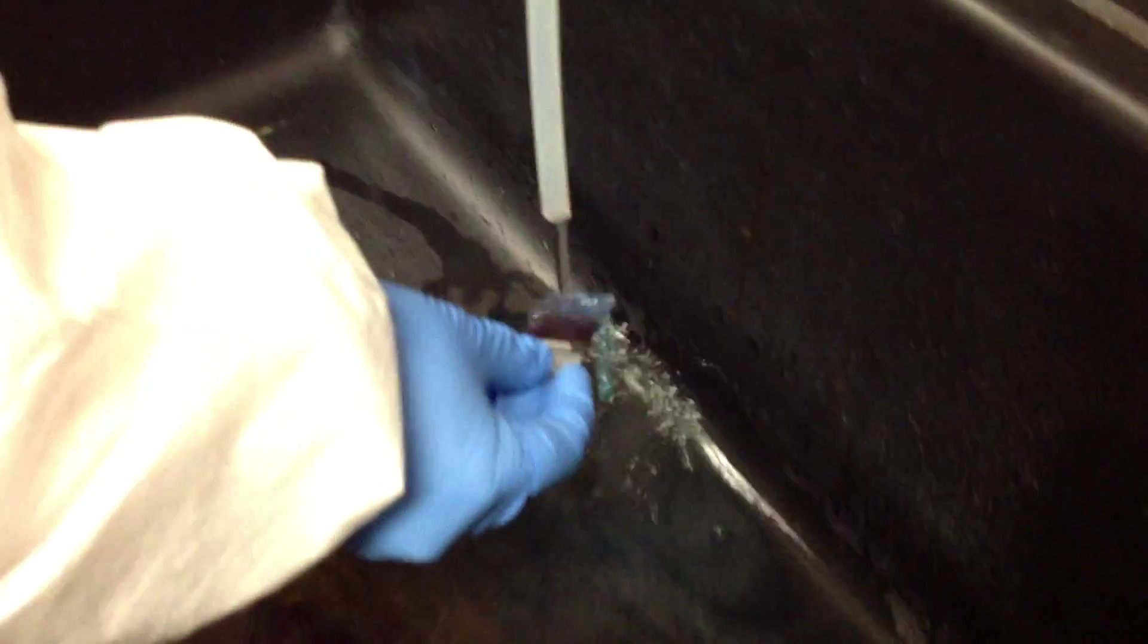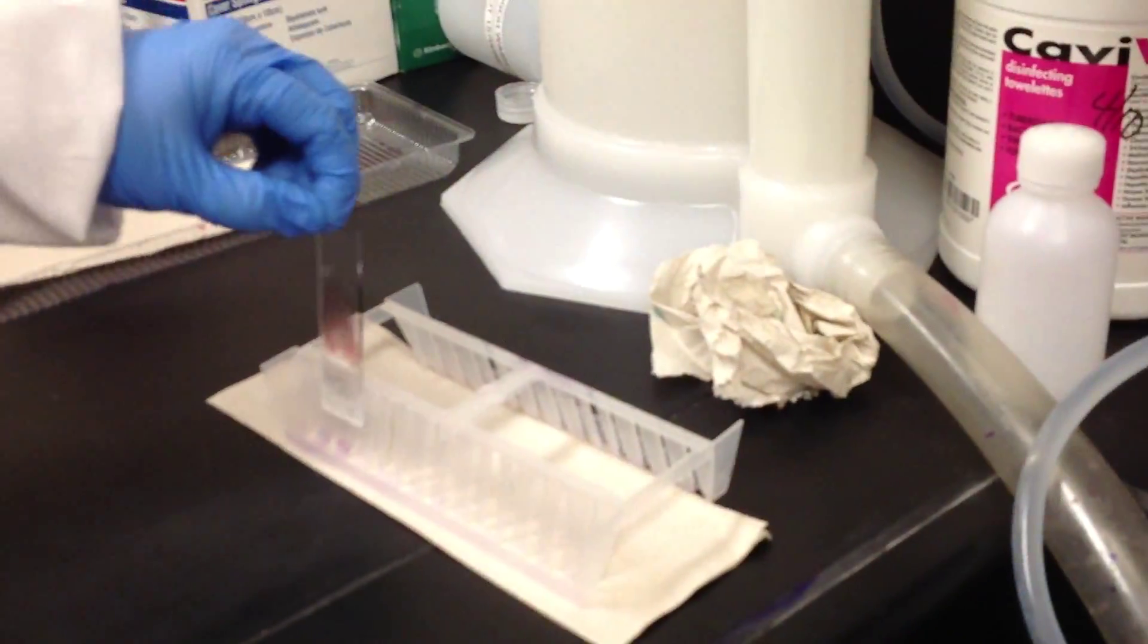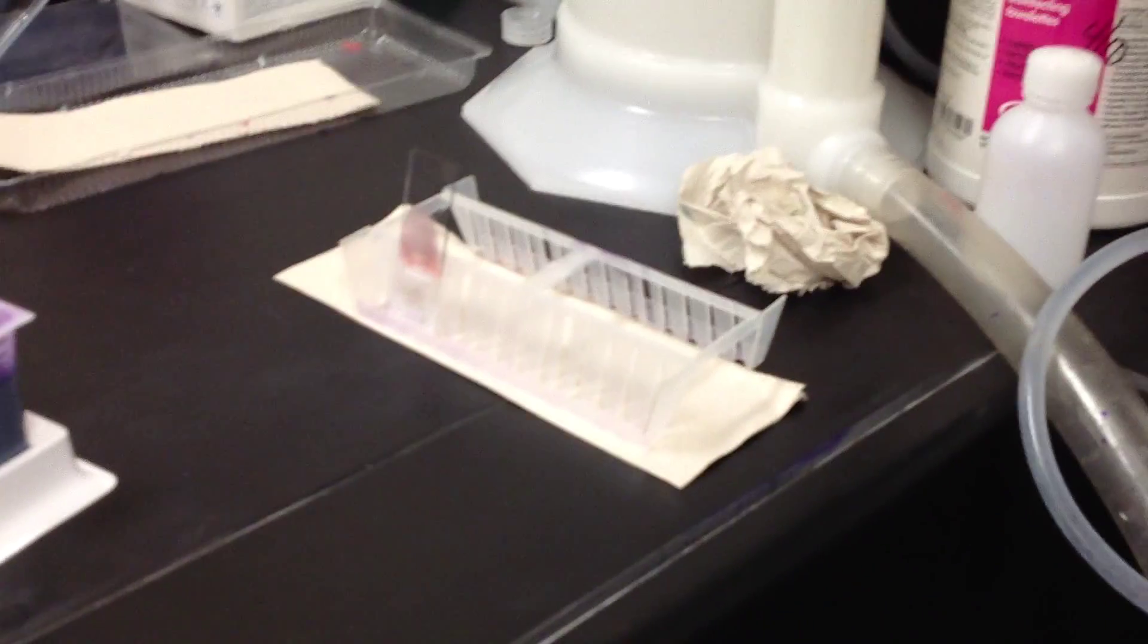Backside against the water. Gently flip it over to the blood side a few times, back and forth, until your water runs clear. And then label-side down, just going to set it in the drying rack. We will not touch these again until they're dry.